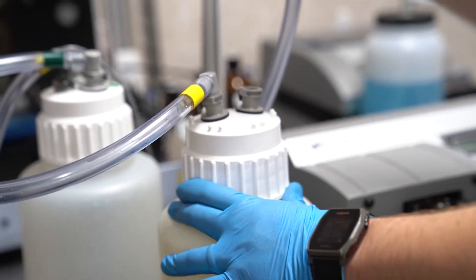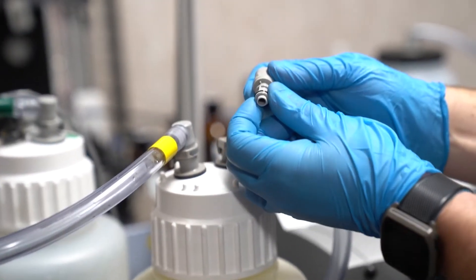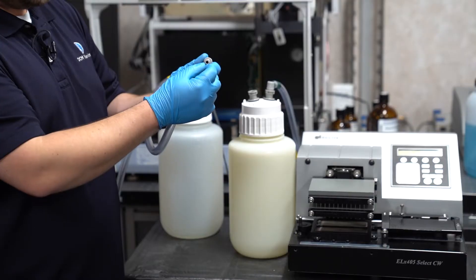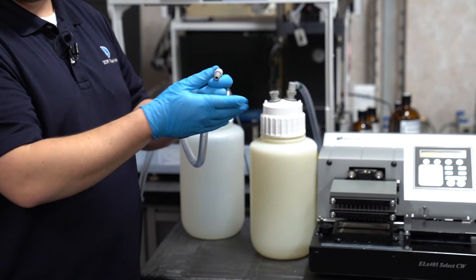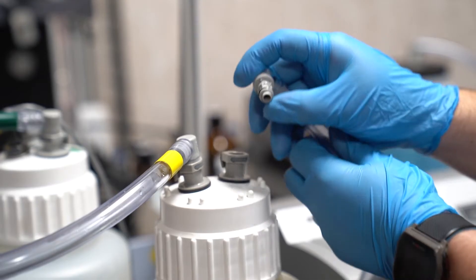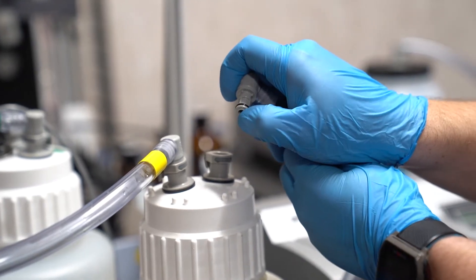The male fittings are easy to inspect. We simply want to make sure the o-ring on the end of the fitting is in good condition and present. The fitting itself doesn't appear to be damaged or mangled, and the spring-loaded quick connect section actuates smoothly.